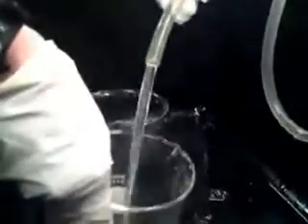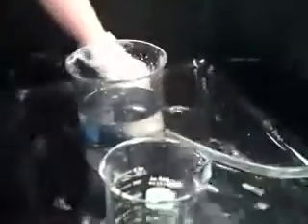Take the glassware and rinse it a couple of times with tap water to remove all solid substances. Then scrub the glassware with a soapy brush of an appropriate size.